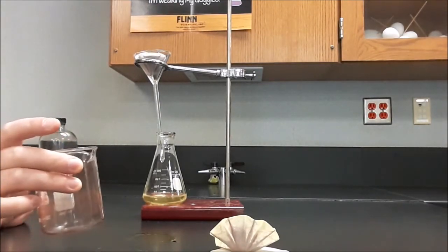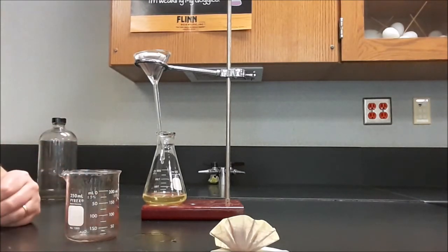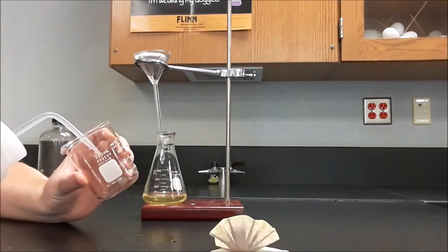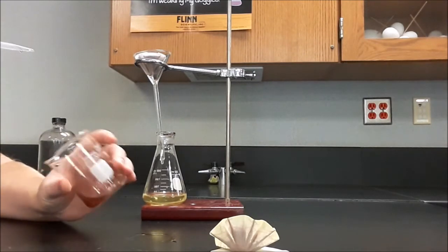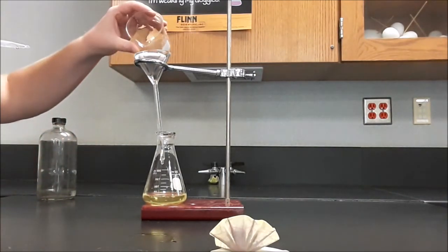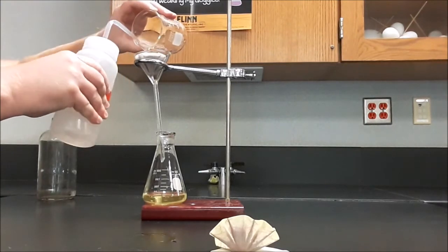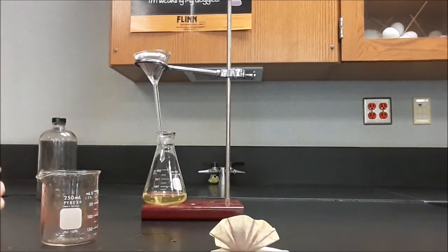I've got a little bit of reddish brown on the sides here. I want to rinse that down with DI water. That's a mistake that I made with the flask that I'm not going to make a second time with this beaker. This beaker contains the precipitate. If I didn't rinse it down, that would be an experimental error. So there's still precipitate in here, and I want that precipitate to end up in the flask. And you can see that's not nothing. Can rinse down the walls of that. And I'm pretty sure I got all of the precipitate out of that beaker. Now I simply wait for this to finish.